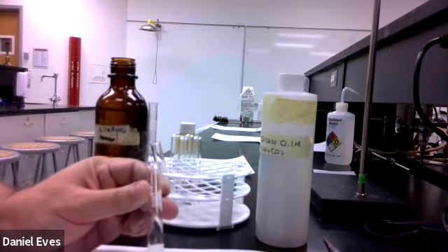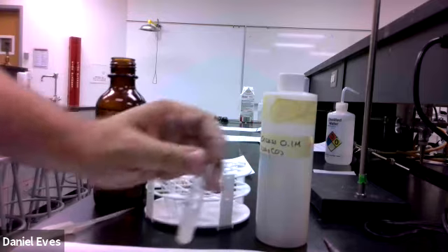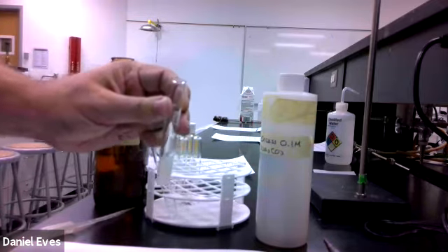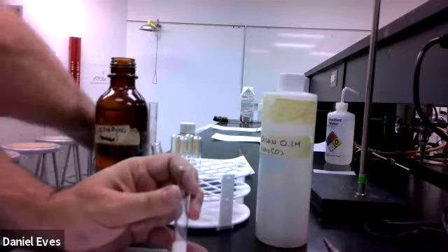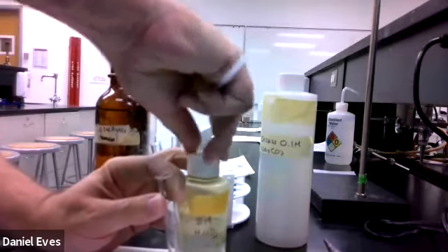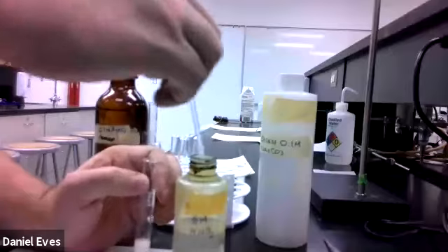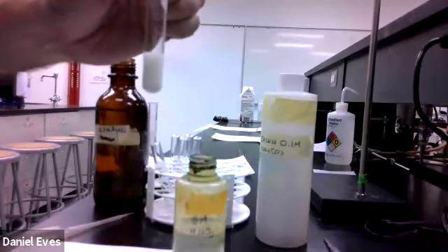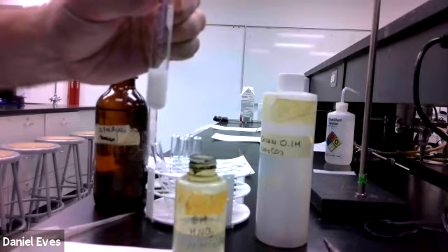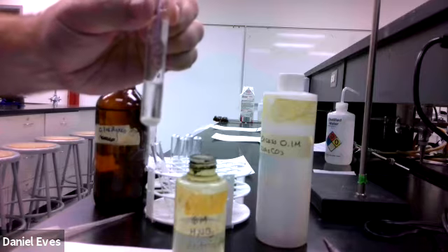Now, the next thing that we want to do is add acid. If we add acid to a carbonate, everyone should know that that should make bubbles. We're going to make carbonic acid and water. So what I have here is a 6 molar bottle of nitric acid. I'm going to go ahead and add some of that nitric acid to my solution here with the carbonate. So I put some of that in there. Oh my, some things are happening there.